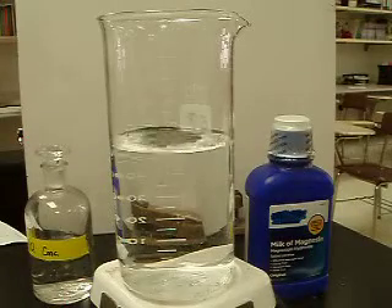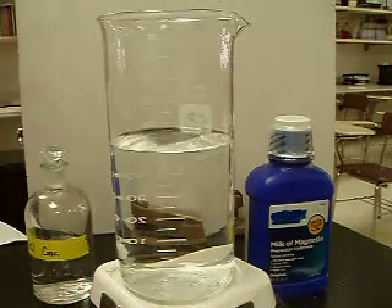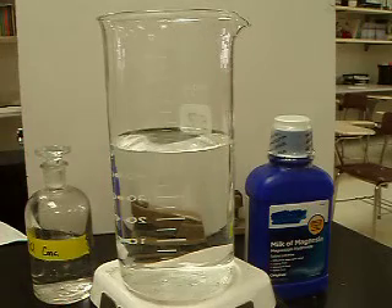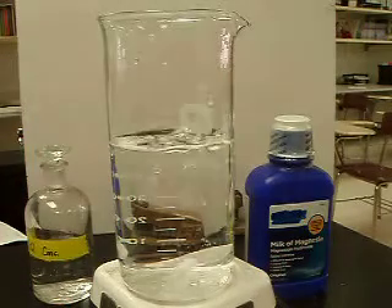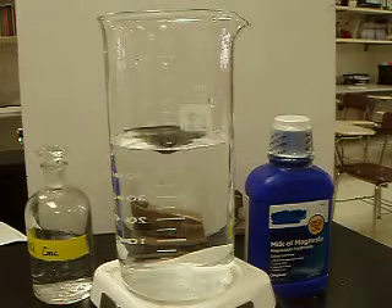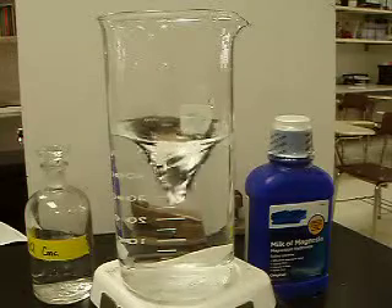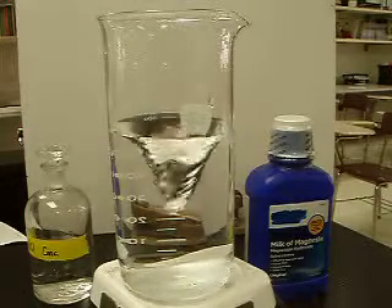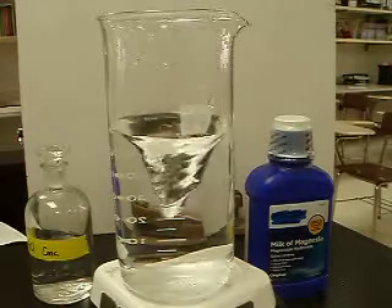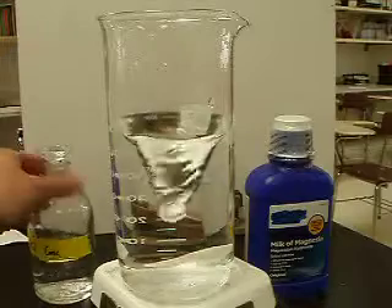Just some distilled water. This is a little bit of an equilibrium demonstration. We add to the distilled water a magnet, and we turn on the stir bar. We get the water spinning — it's not quite a solution yet — and you get it spinning up to speed pretty good here.